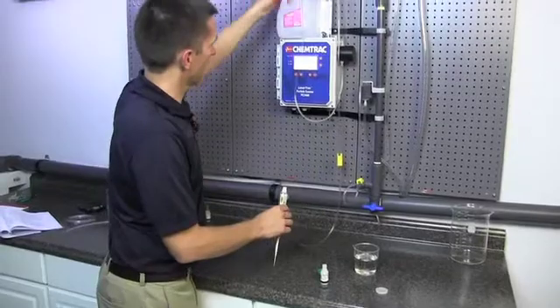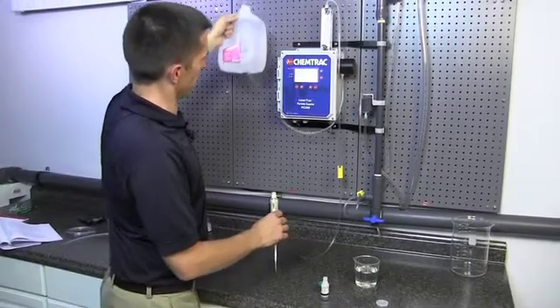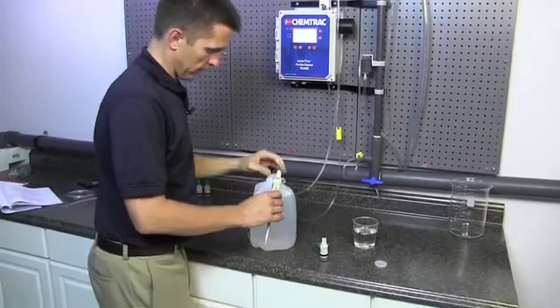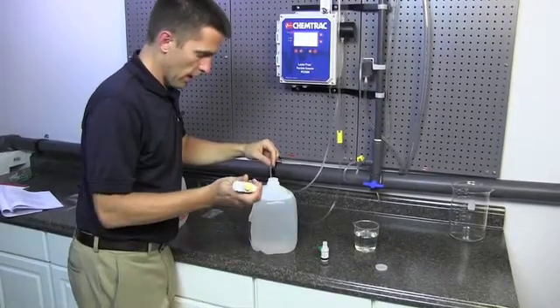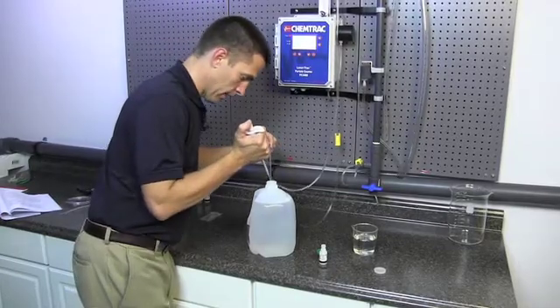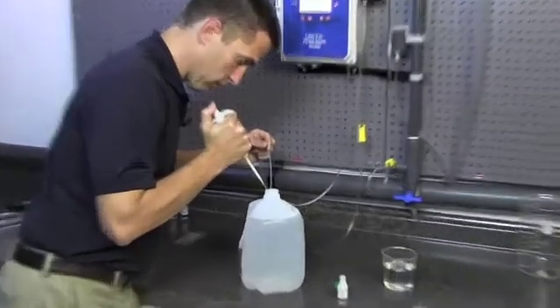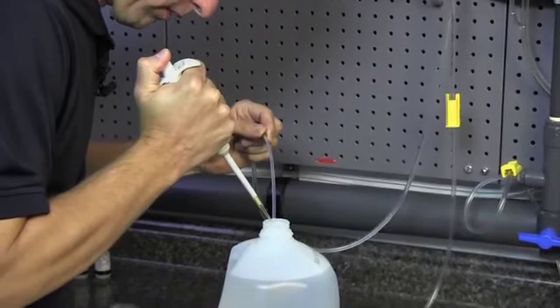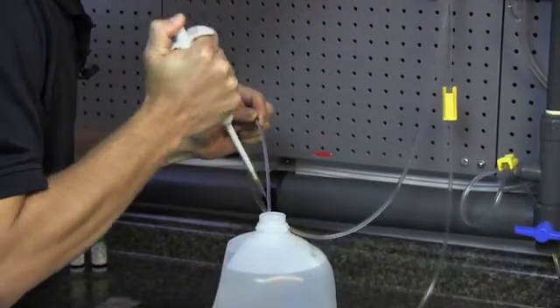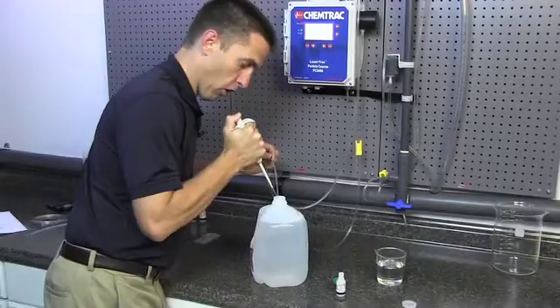Now, we're going to take our jug that we already checked and bring it down. And what I like to do is take the pipette and get it right against the edge of the tubing. And we're going to depress our plunger. What I don't want to do is stick the pipette tip into the water.